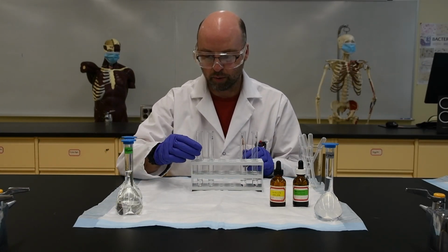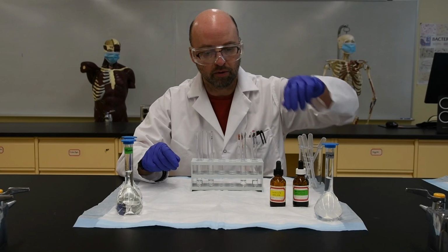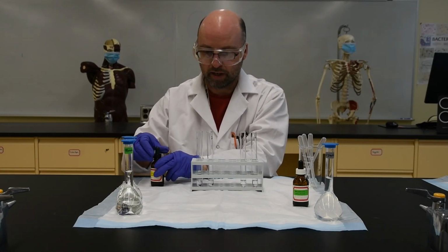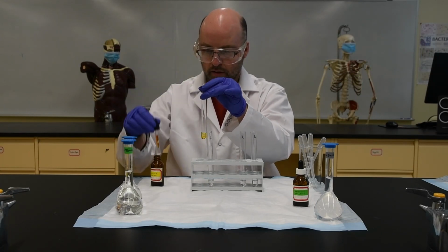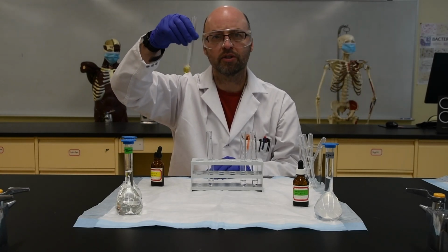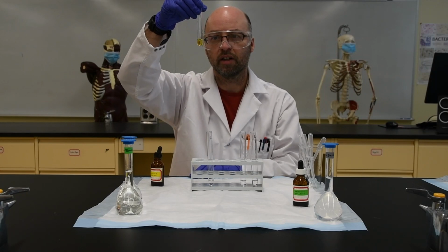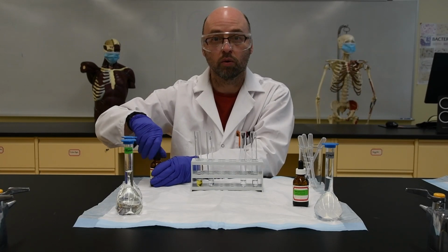So now what we want to see is what a negative starch result looks like. If I add iodine, which is the test for starch, to the water tube, let's just see what the color ends up being. I'm going to add a few drops of this here, like that. Give it a little bit of a swirl. I'll show these tubes close up afterwards as well. But you can see that a negative test for starch with Lugol's iodine is a kind of yellowy amber color. So you can write that down in your table.